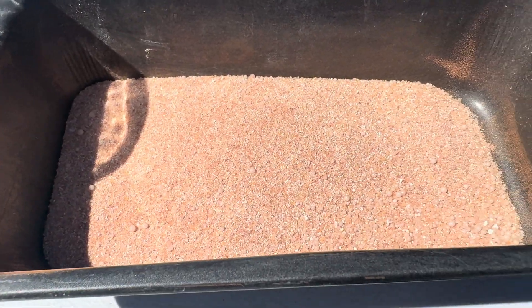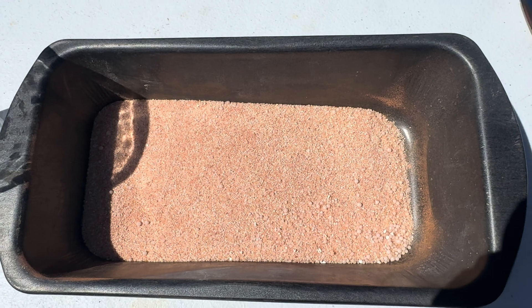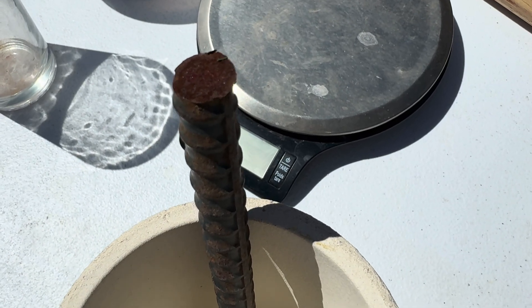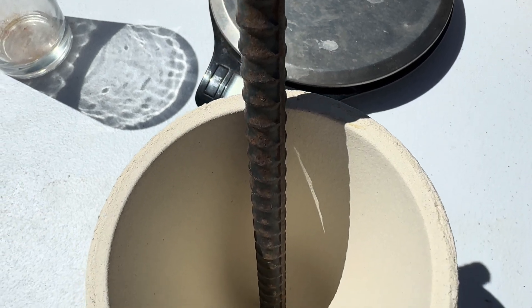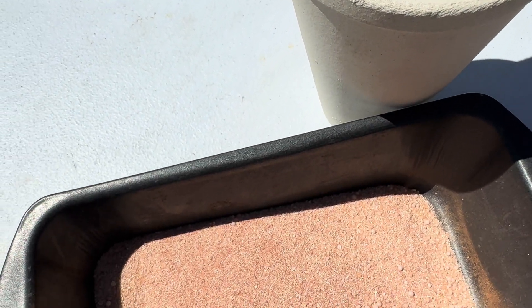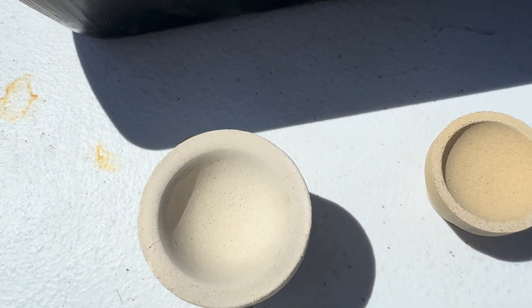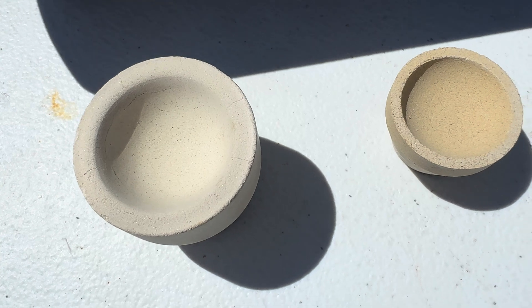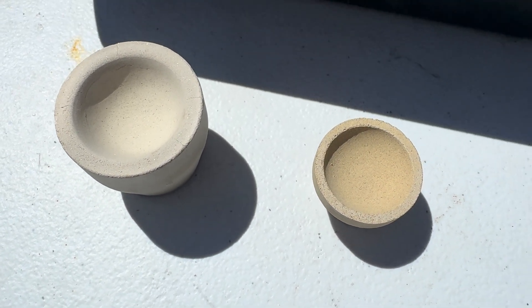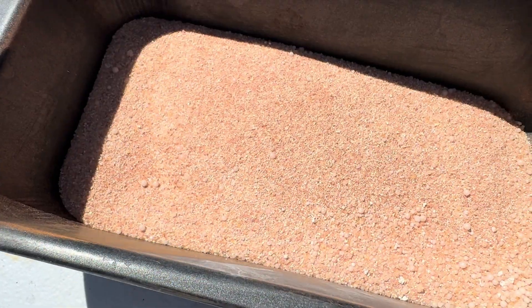Here is our flux that is ready to be poured into a heated crucible. We are going to use a brand new clay crucible that I picked up from Legends Mining Supply, and we also have a stick of rebar as a collector metal. Here are two cupels also from Legends Mining Supply in Sparks, Nevada — the one on the left is a 56-gram cupel and the one on the right is a 15-gram cupel.